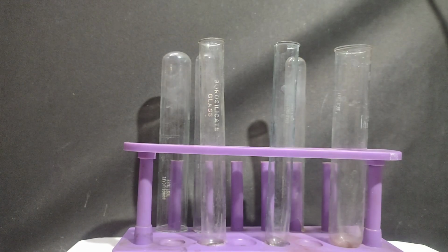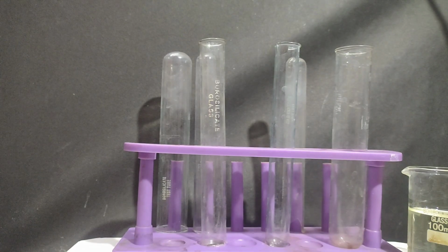So in this video, I'll be showing you the test for carbonate ions, which is very easy. And also, I will show you how you can distinguish sodium or potassium carbonate from bicarbonate. It is in the dilute HCl group and is the easiest radical to be identified.